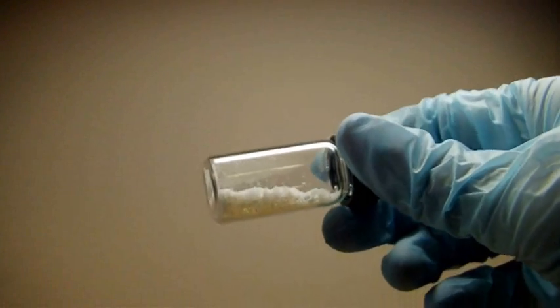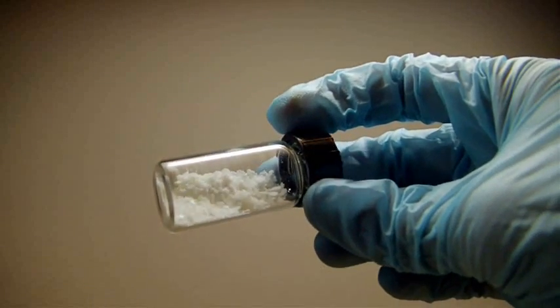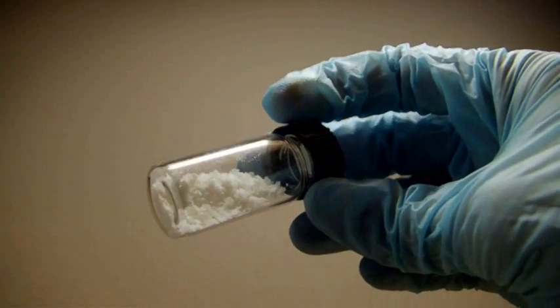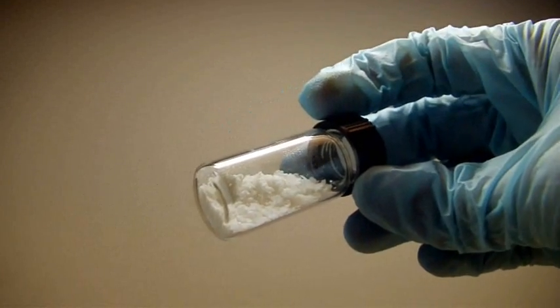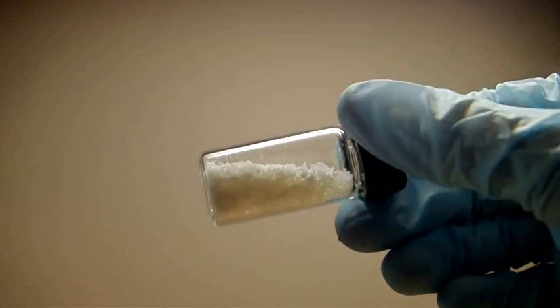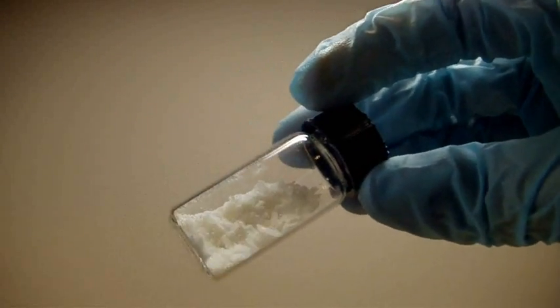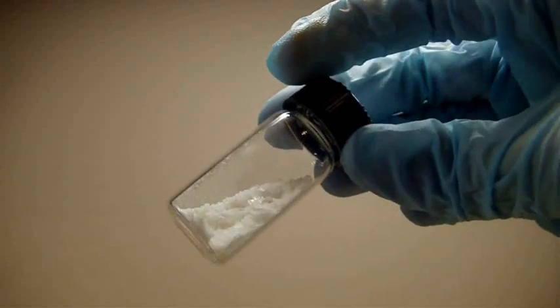So here's my final product of potassium iodide crystals. I boiled most of the solution down to get this powder and I let the rest of it evaporate on its own. Despite what I said earlier about contamination, this looks pretty pure. It's a really bright white, came out looking pretty nice.